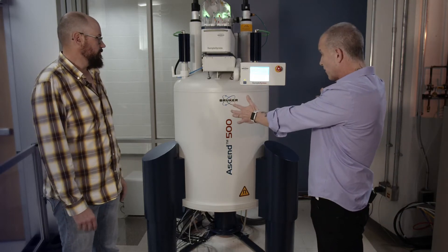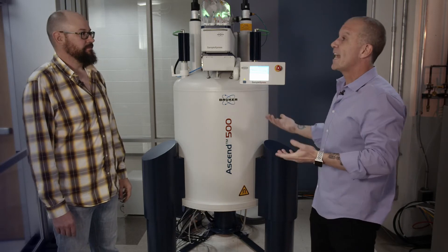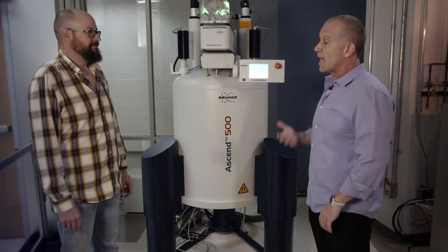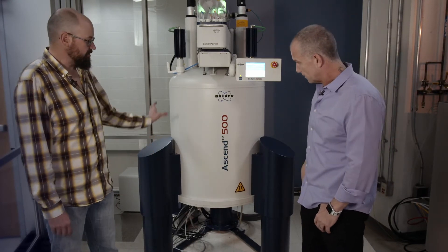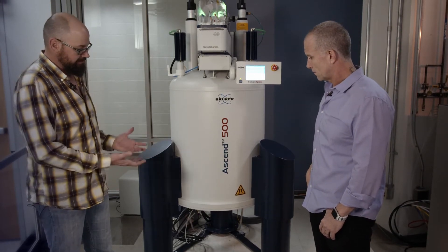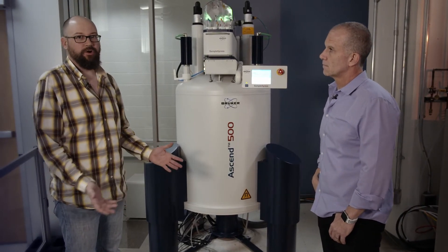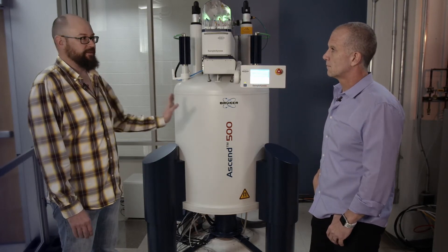The volume of these large superconducting magnets is mainly the volume of containing that liquid helium and liquid nitrogen. They often sit on very beefy legs, for a very explicit reason. Contained inside these legs on this particular magnet is a sophisticated set of gimbals that isolate the magnet. It's levitated on a cushion of air, and it vibration-dampens building movement, because we're measuring things on the order of a hertz or less, and building shake on that level can show up in our data.